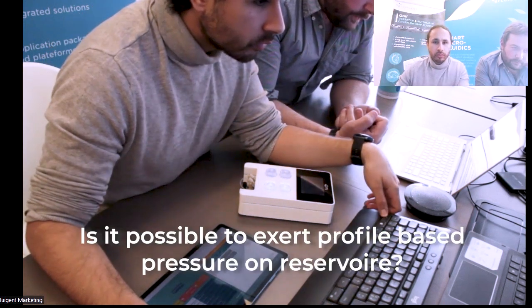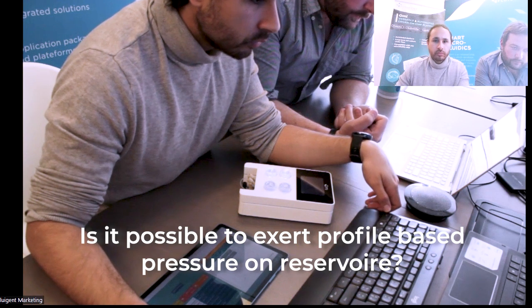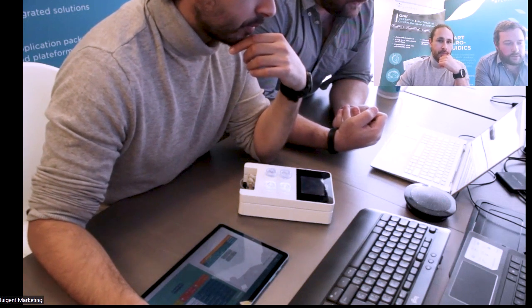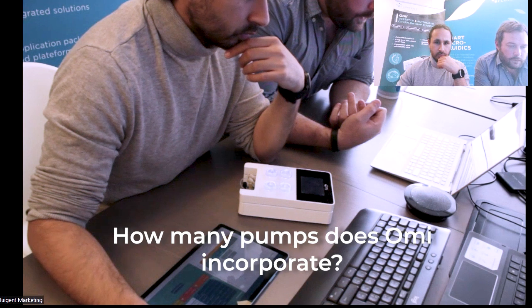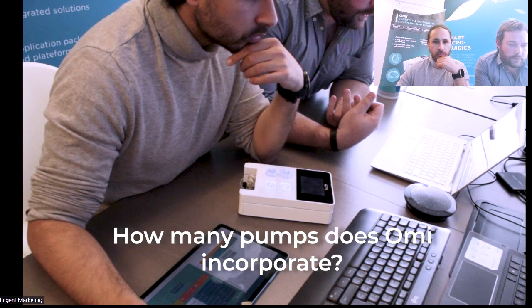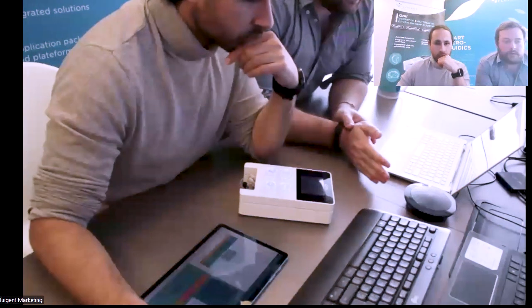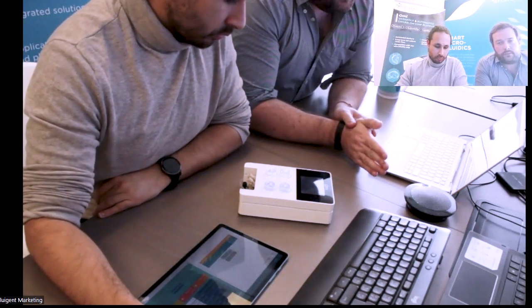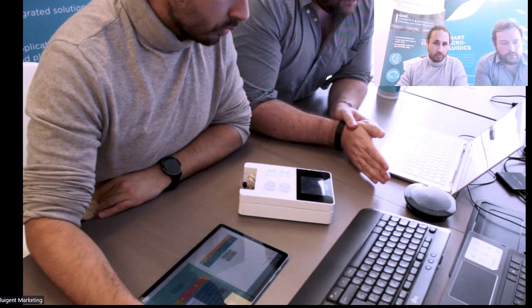Is it possible to exert profile-based pressure on the reservoir, like a sinusoidal? Yes, it's possible, and it will affect the flow profile as well: sinusoid, square, and triangle shapes. So how many pumps does OMI incorporate? One for each reservoir? No, there is one central pump, and the pressure is addressed individually in each reservoir through one pressure selection valve associated to each reservoir.